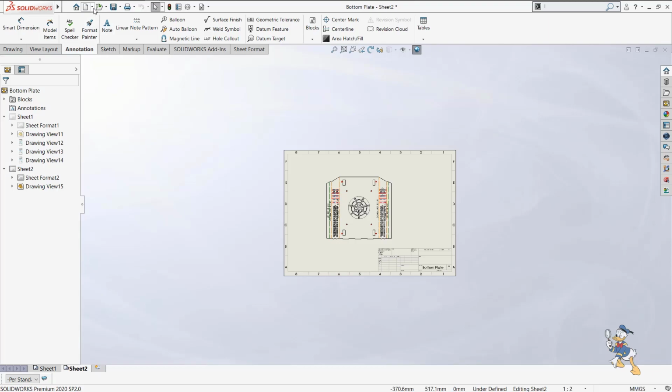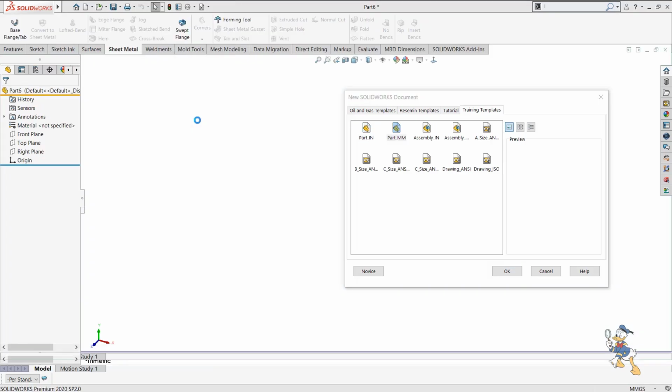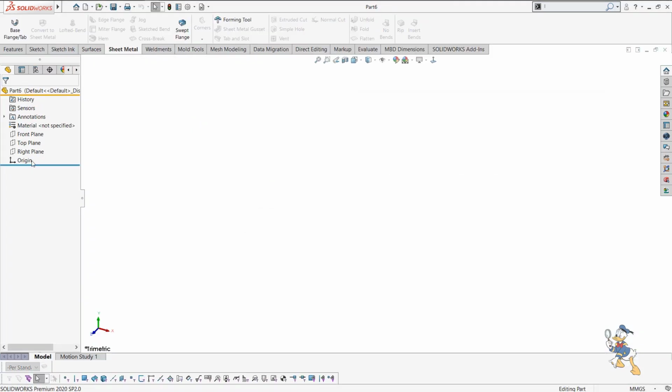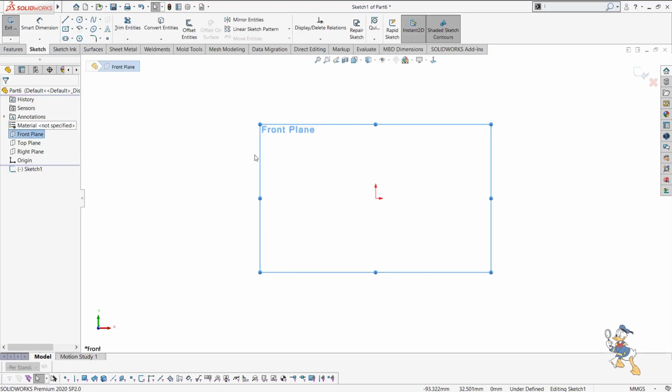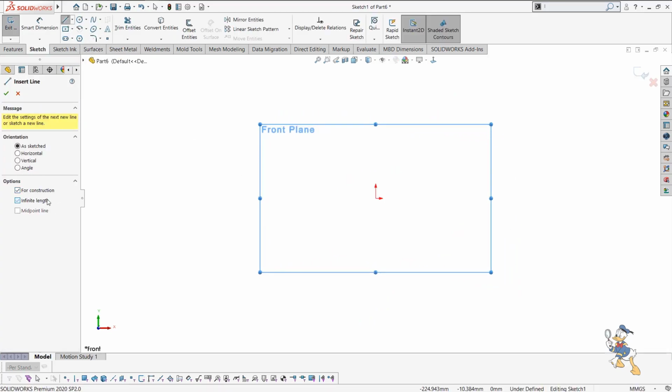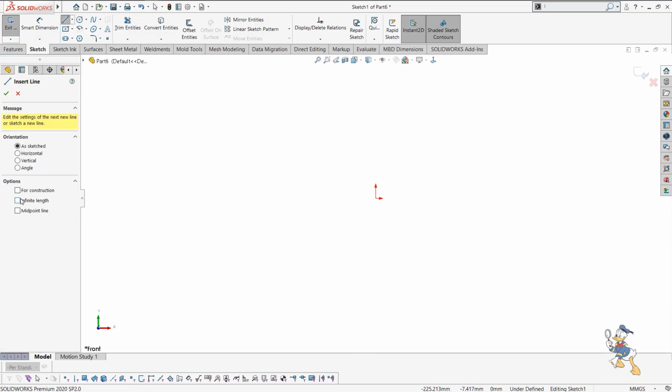So now suppose we need to design some sort of plastic component. So let's see how plastic components are easy to design in SolidWorks. Suppose we need to check it over here. Suppose we need to generate a line again. Yeah, this one. It is very easy. I just need to generate some sort of lines for this.